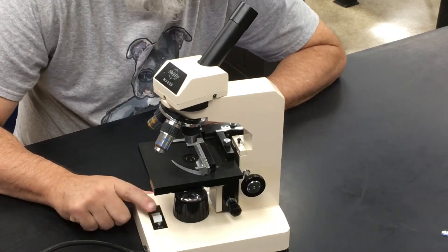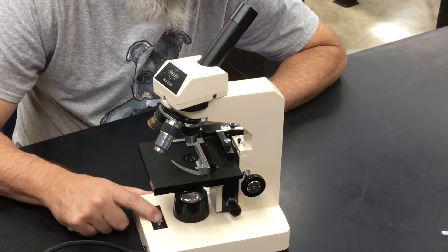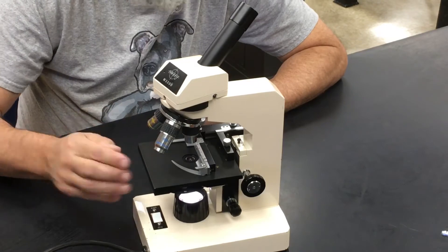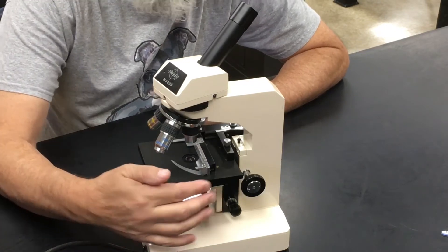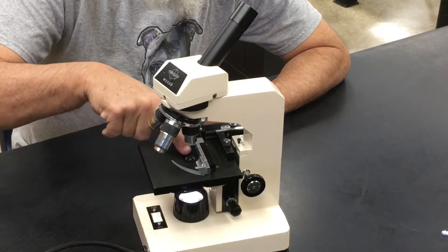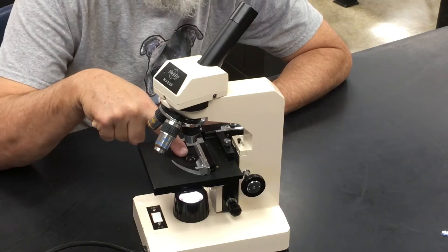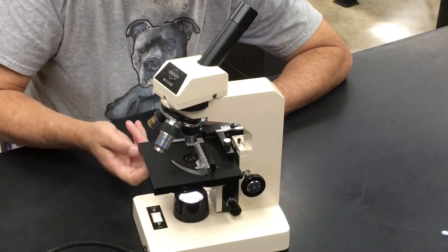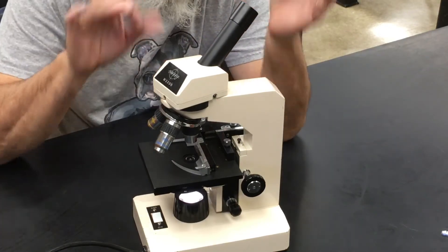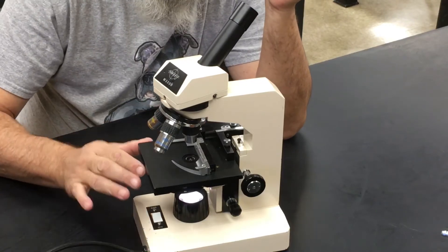We've got the power cord — I've got it plugged in. This right here is called the power switch; that turns the light on and off. The light comes through this flat platform called the stage, and if you look closely there's a little glass window there called the stage opening, where the light comes up through your specimen so you can look at it through the lenses.